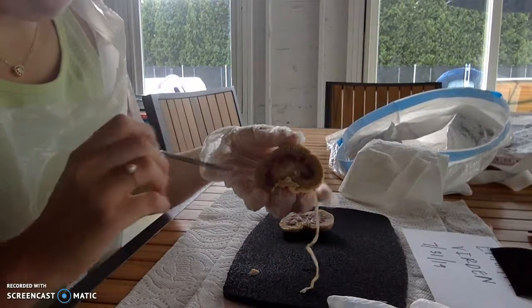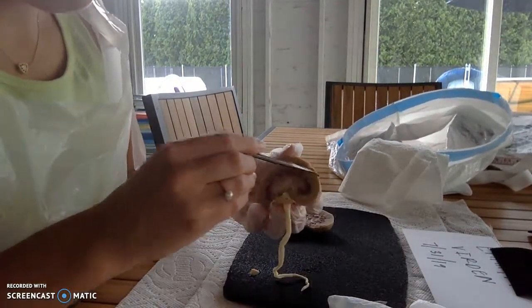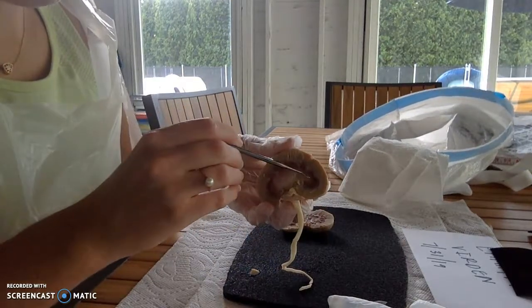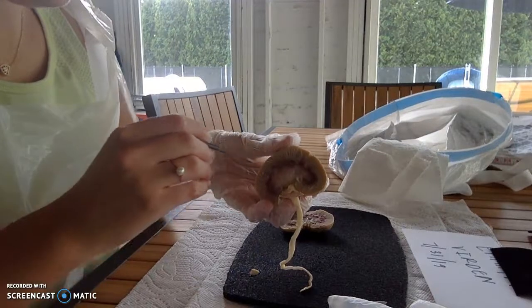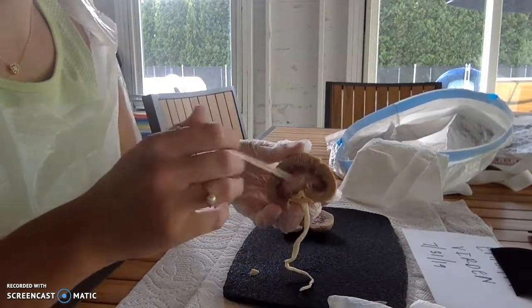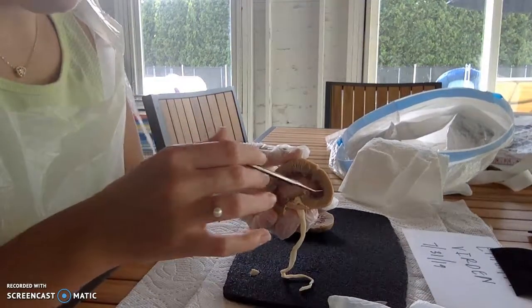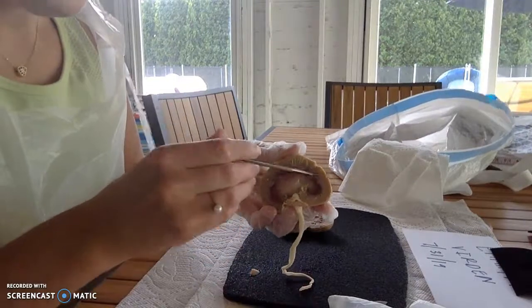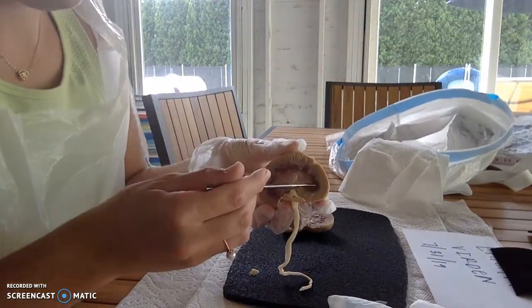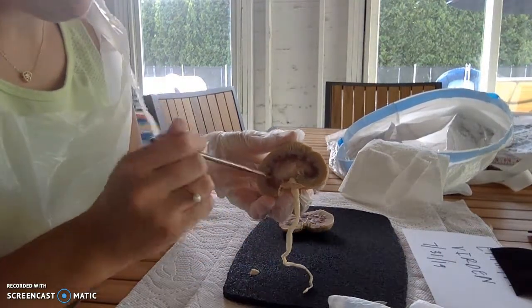And then we're going to move to the interior, and you have the renal cortex, which is this area here. You have the renal medulla, which is this area here. Each medulla is kind of broken up into oval triangle type things, and those, the interior portion of it, are the renal pyramids.